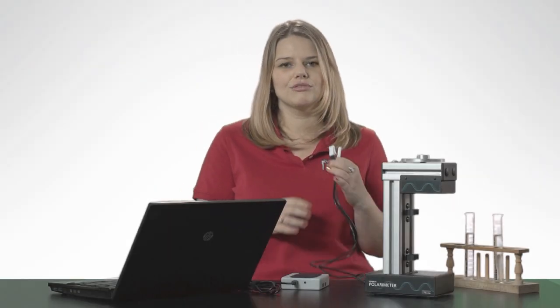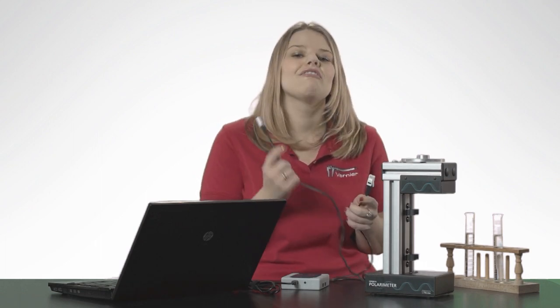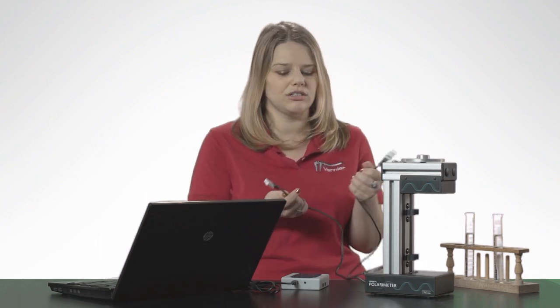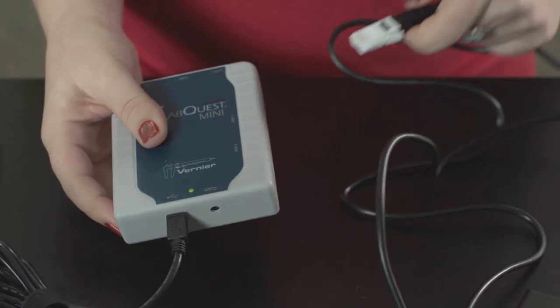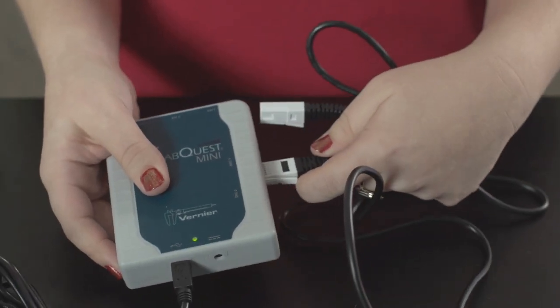First thing to note is that it has two cables coming out of it. One is an analog and one is a digital. They will only fit into specific ports on your interface.